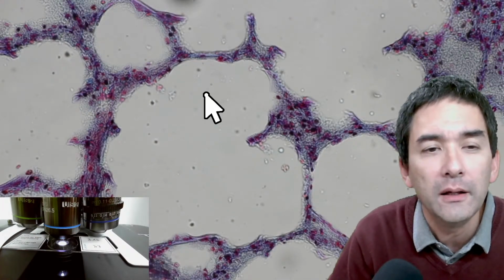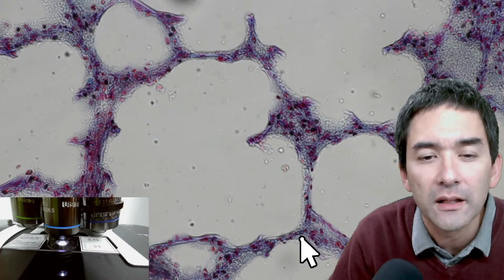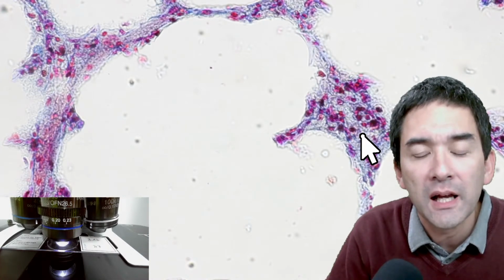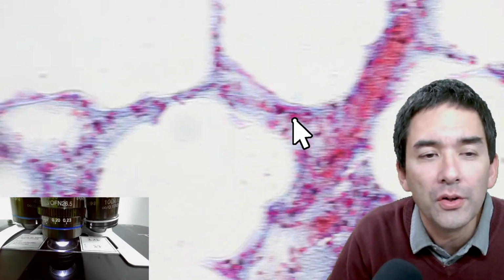You see that the dark dots are the nuclei of the cells. The cells are of course much larger, but the nuclei stain darker because very often the company that made those slides used stains that stain DNA, and the DNA can be found inside the nucleus. So all of those dots here are the nuclei. And look at this. This red thing here looks a little bit like a blood vessel. Red blood cells are here. And you see that the walls of those alveoli are fairly thin, just a few cell layers thick.